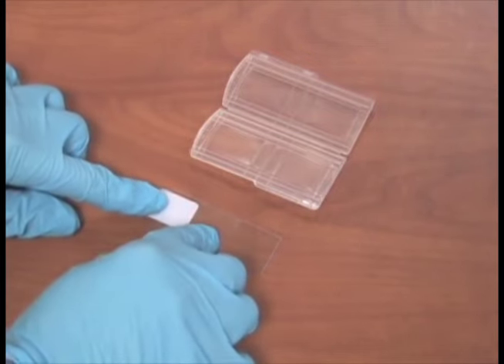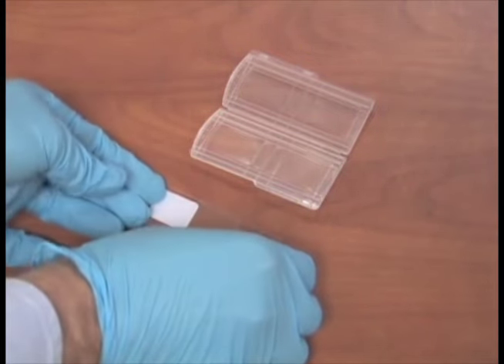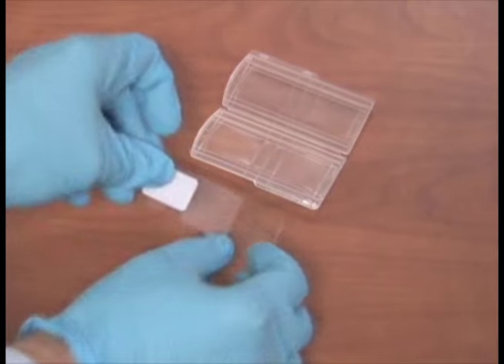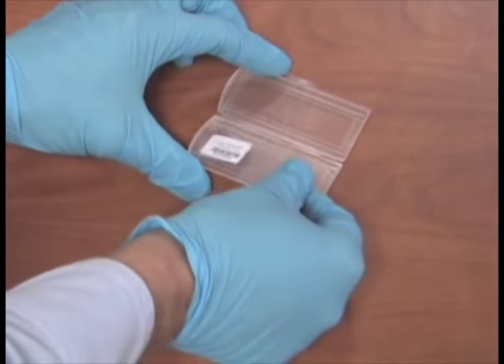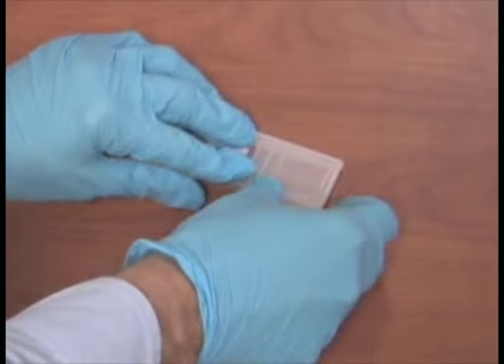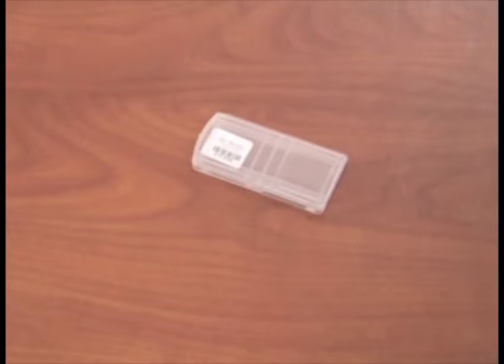4. Gently press down on the tape using the other hand. 5. Slowly peel the tape slide off the surface. 6. Place the slide inside the plastic container.